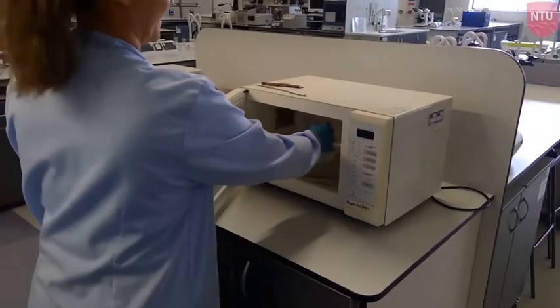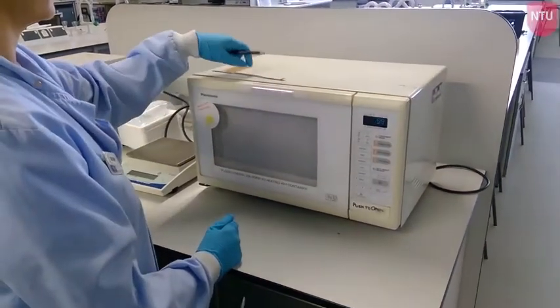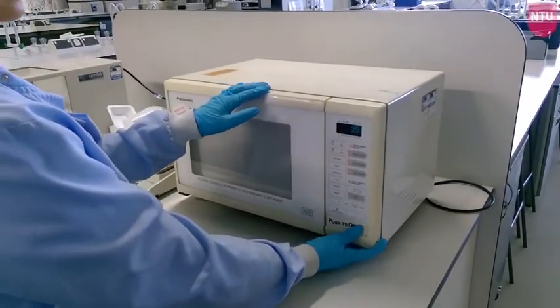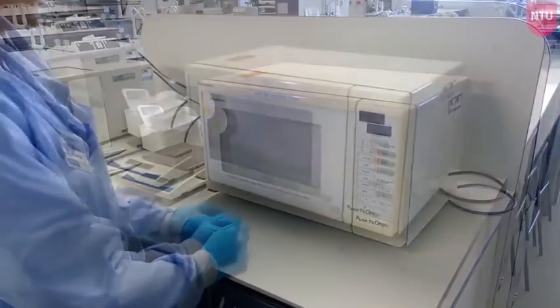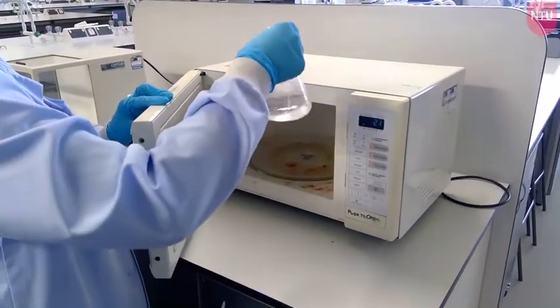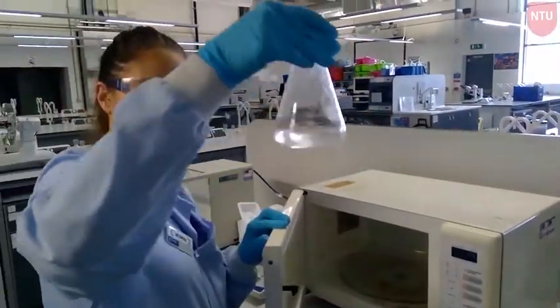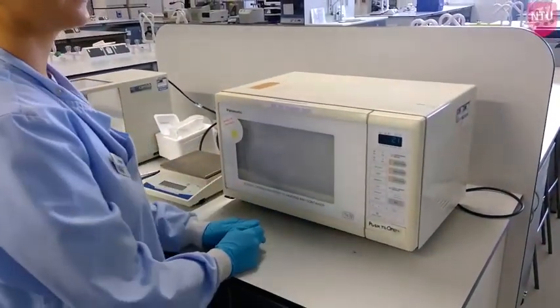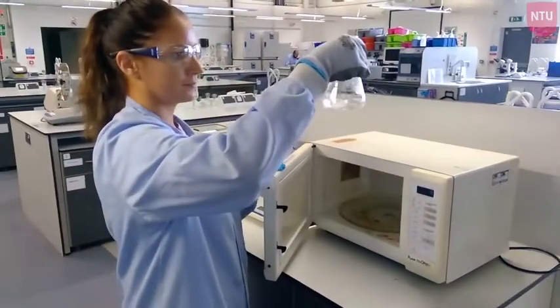Carefully pour the agarose powder into the flask with the buffer and gently swirl to mix. To melt the agarose, use a microwave. Set it for one minute, but check after 20 seconds and more frequently as it heats up. Never leave it unattended and do not allow it to boil vigorously — use a heat-resistant glove. When sufficiently melted, you will see a clear solution with just a few grains; a cloudy solution means it is not yet fully melted.